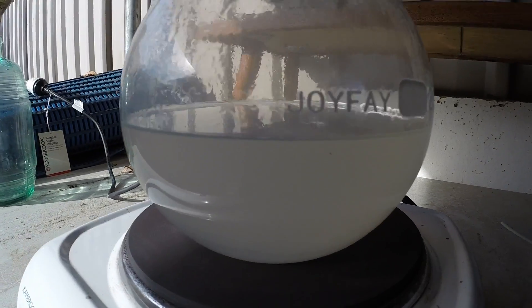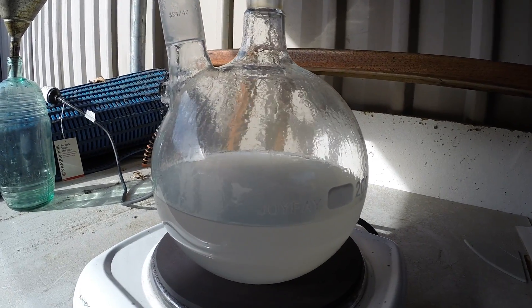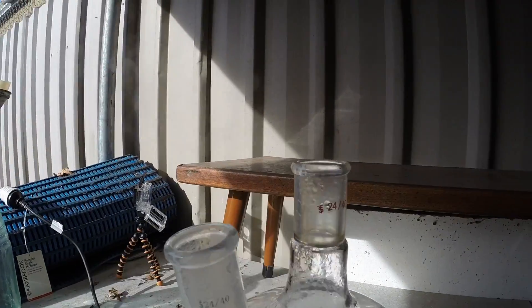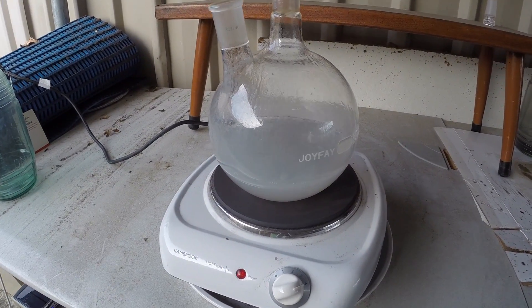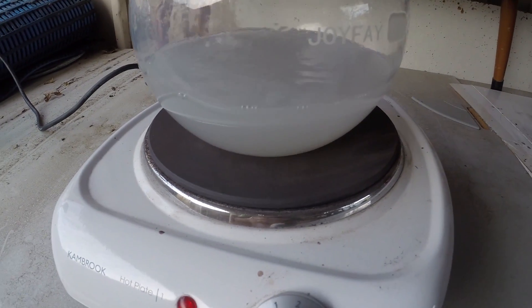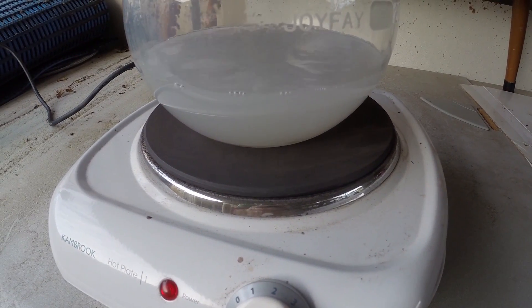You can see it's got a very cloudy color now. I've topped it up with a little bit more — it's just going to need to go for a number of hours. Our acid is still boiling away nicely. You can see the actual liquid has gone white now. I don't know what that means — I don't think it normally would go white — but we'll have to see when it cools down.